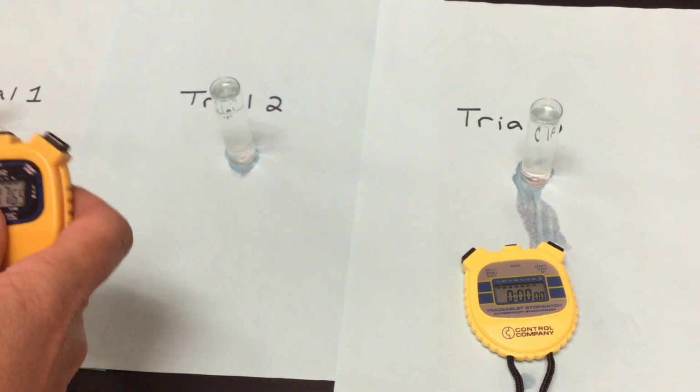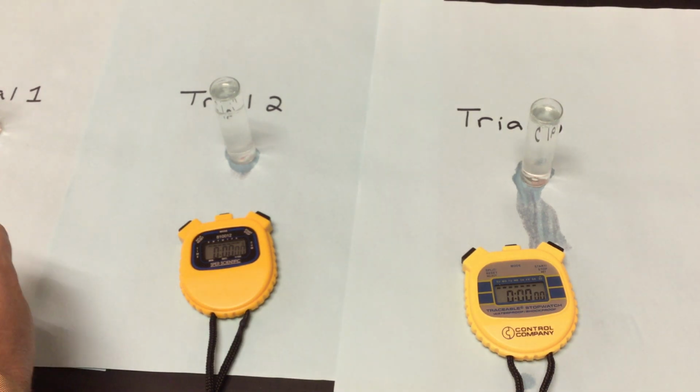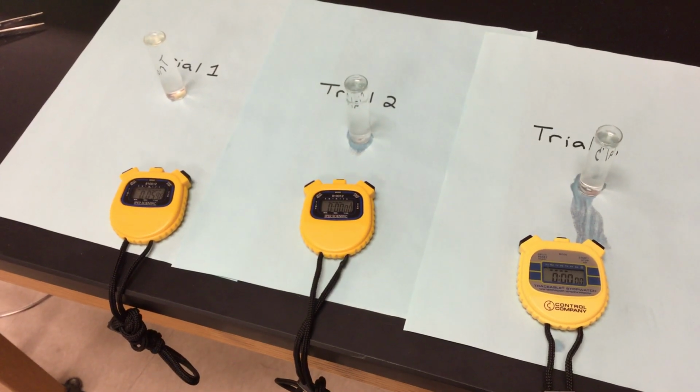Now we're on that pH. I'm going to reset my timers. I'm going to do the same thing. Same yeast, same discs, same timers, same everything. So I'm going to grab my first filter paper disc. And it's real important to make sure that we only have one, because like I said, if we have 2 of them and they're kind of stuck together, then it's going to change our results. We're dropping our first one in. Let that go all the way down to the bottom. Starting my timer there. I need to close this up a little bit for you guys, but my first one is in.